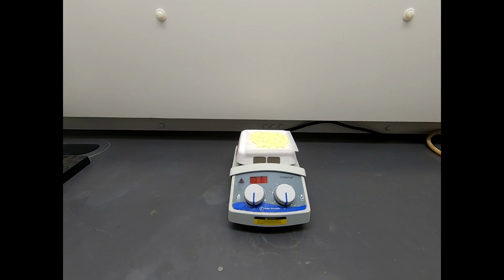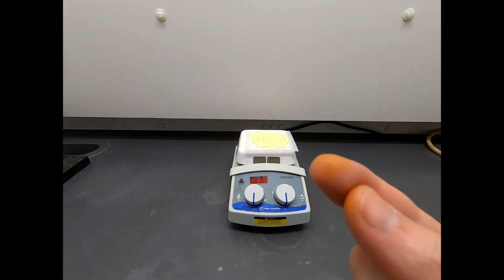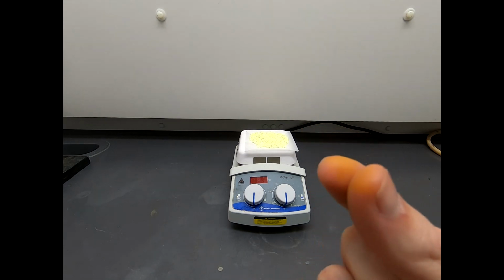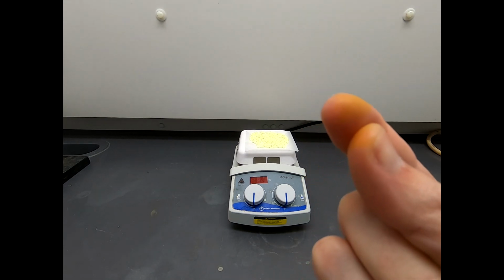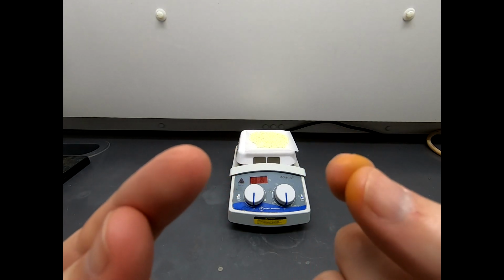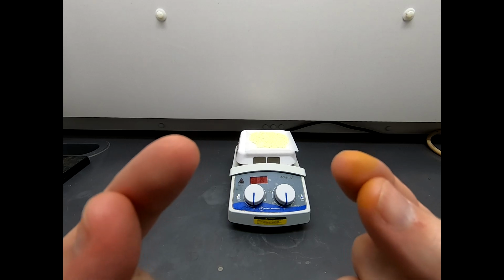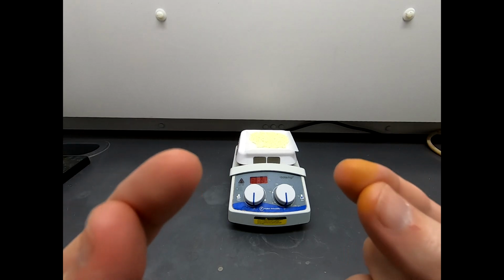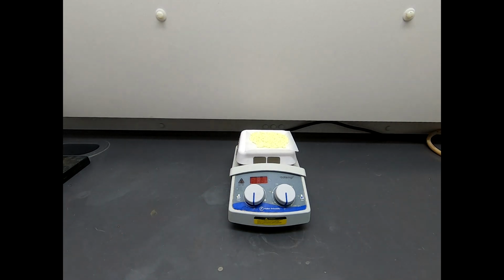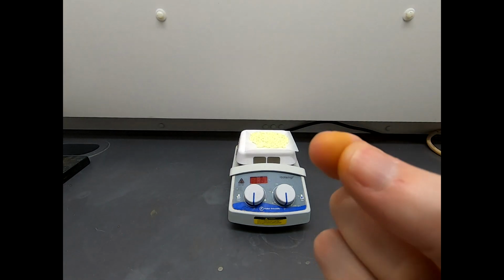Before we wrap up, I want to point out one other thing. So here is my finger, and I don't know if you can see what my finger looks like, my thumb a little bit too. There's a little bit of yellow on there. Like my other finger doesn't look like that. So this finger's a little yellow. So what happened there? Well, what happened is I worked with nitric acid without wearing gloves. And nitric acid, when it gets on your skin, it'll turn it a little bit yellow.